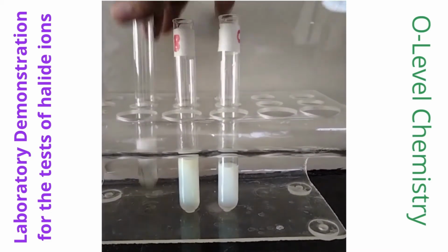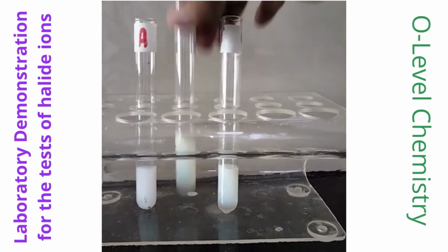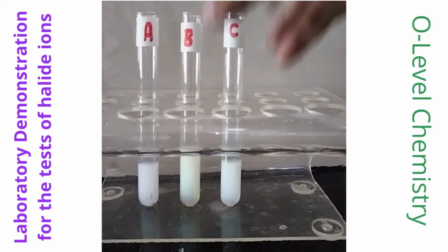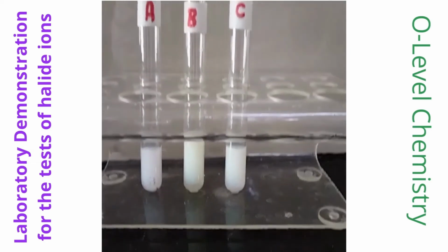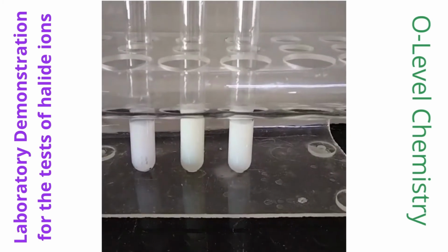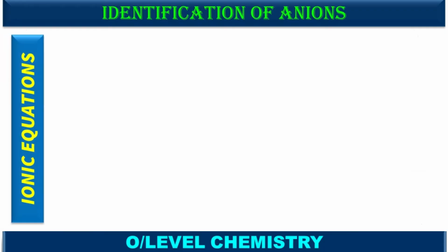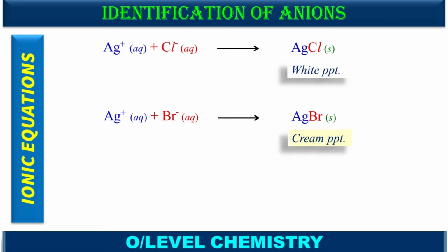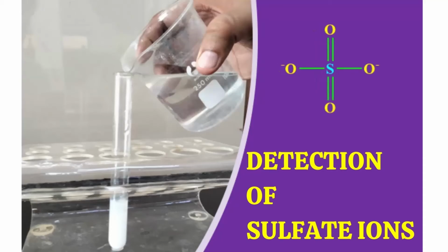To make sure that the 2 solutions are mixed together well, shake the test tubes as shown. You can see the white, yellow, and cream colored precipitates, respectively in A, B, and C. So, A contains chloride ions. B contains iodide ions, while C contains bromide ions. Here, ionic equations of these reactions are given, which show how silver ions combine with halide ions to produce their respective precipitates.